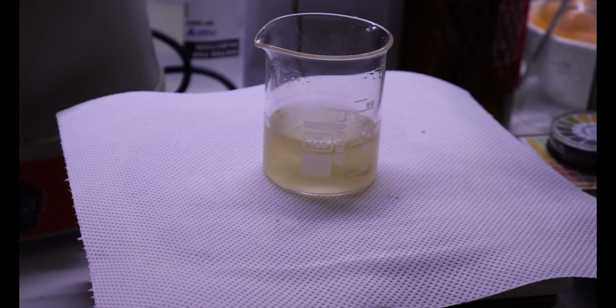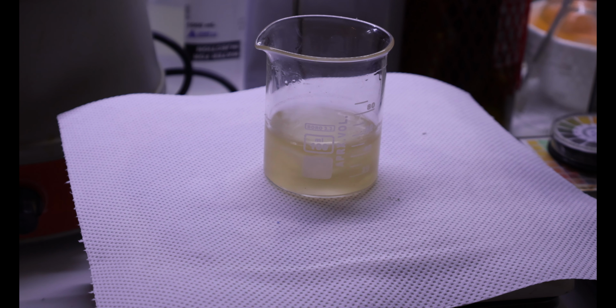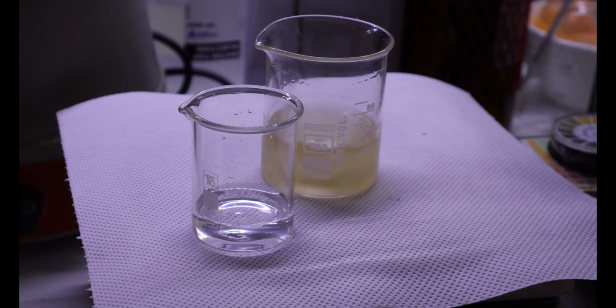Okay, so 15 minutes have passed. I think it's time to do another ferric chloride test, because I believe this is near completion now. Maybe it's even complete. I do not wanna convert every single molecule into acetylsalicylic acid. It would be ideal, but chemistry is not ideal. Ideals are ideal, and I do not believe in any ideals.